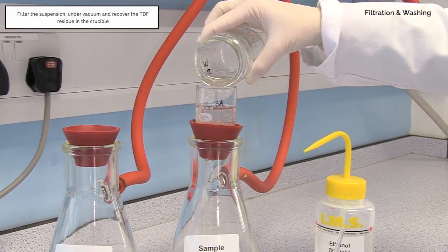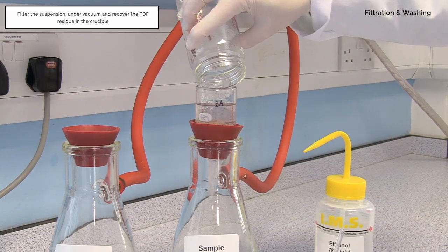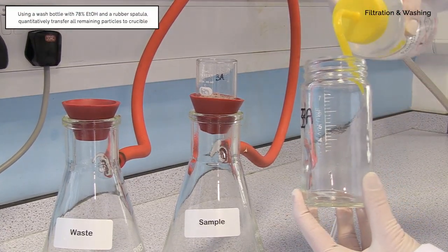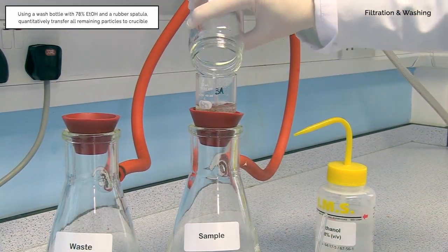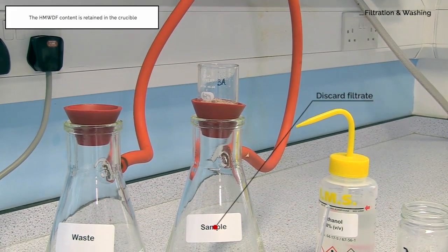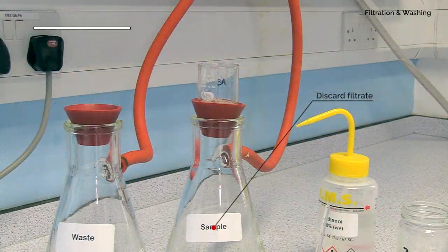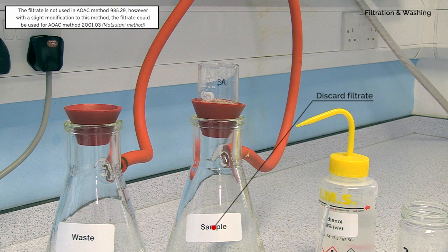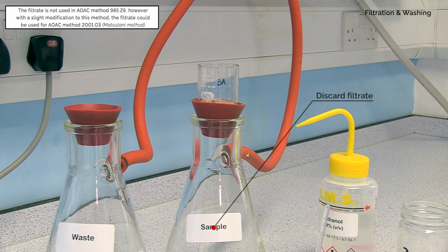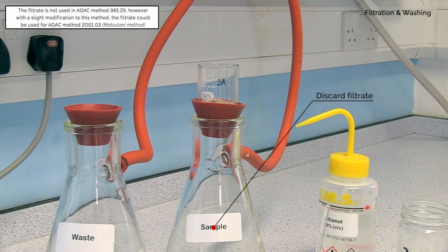Filter the suspension under vacuum and recover the TDF residue in the crucible. Using a wash bottle with 78% ethanol and a rubber spatula, quantitatively transfer all remaining particles to the crucible. The high molecular weight dietary fibre content is retained in the crucible. This filtrate is not used in AOAC method 985.29. However, with a slight modification to this method, the filtrate at this point could be concentrated, desalted and analysed by HPLC for resistant maltodextrins and other soluble dietary fibre solids for AOAC method 2001.03 — the Matsutani method.